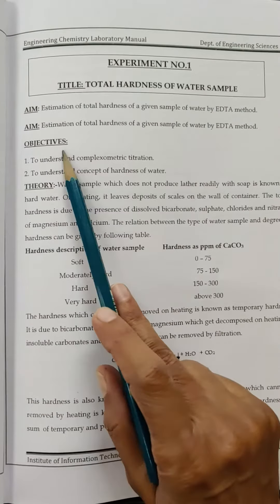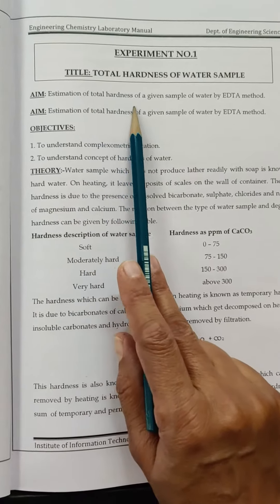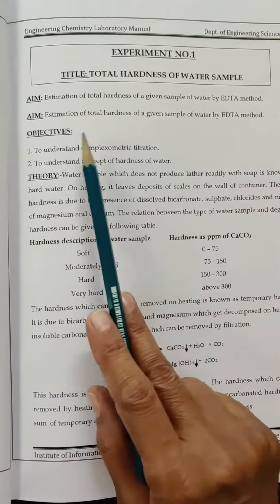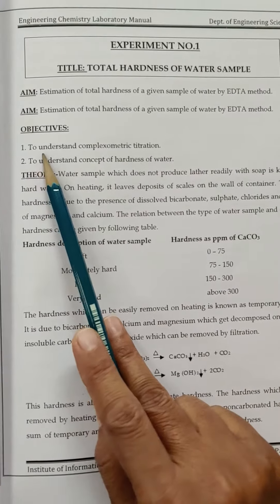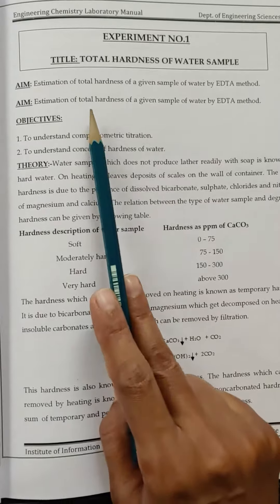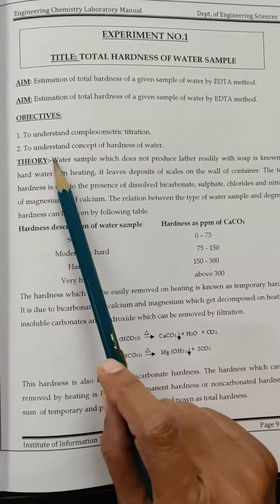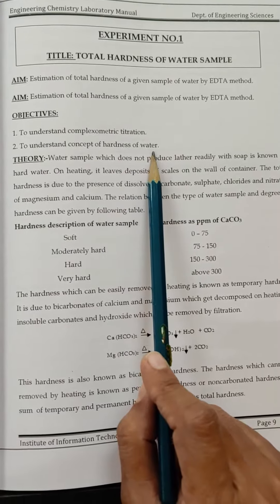The objective — as you can see, the aim of the practical is estimation of total hardness of a given sample of water by EDTA method. The first objective is to understand the complexometric titration, as this titration is also known as complexometric titration. The second is to understand the concept of hardness of water.